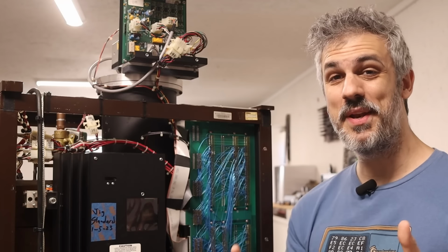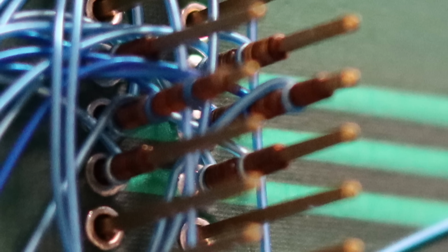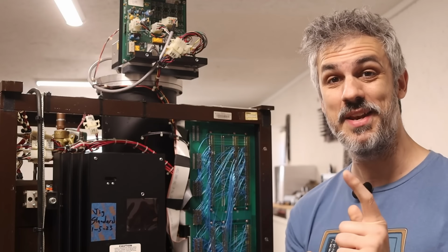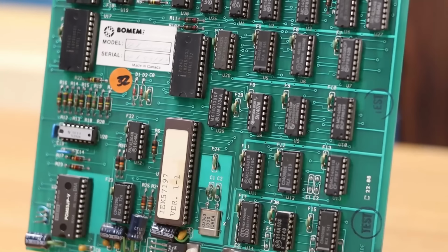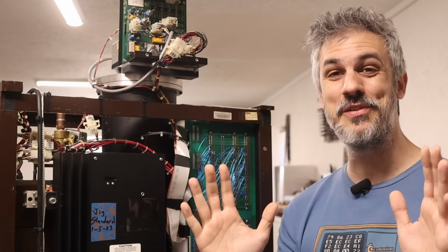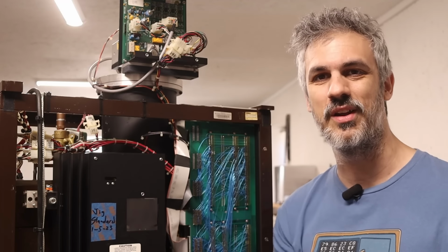So I chatted with Mike a bit about this, and this is super fascinating because this is 100% a production mistake. I checked the other backplanes that he had at his shop and they were all soldered on the inside here, whereas this one is not, and it absolutely should be. But they were saved because the card makes the connection from the solder side to the component side. That card has that connection, which saved them from this production fault. Really cool bit of history to find here, but it means that we didn't explicitly need to make this repair here. We just needed the correct card in the slot.